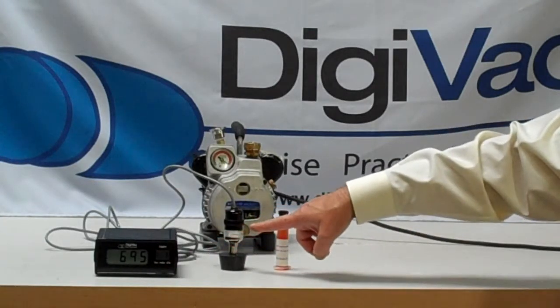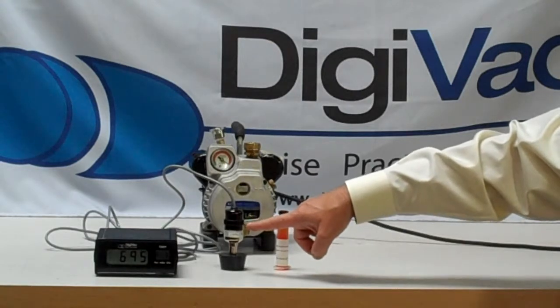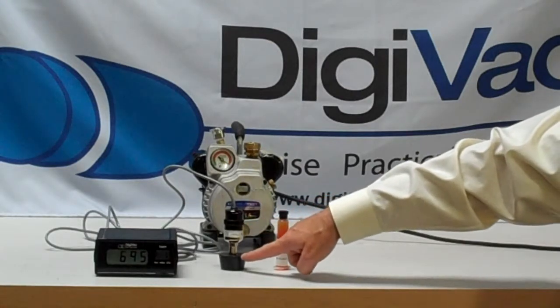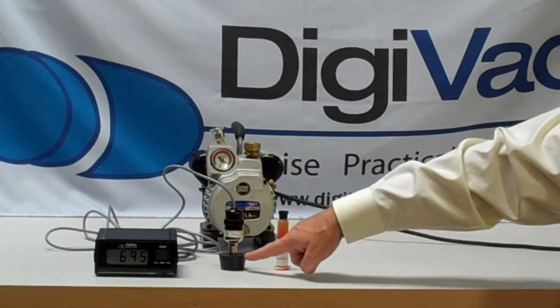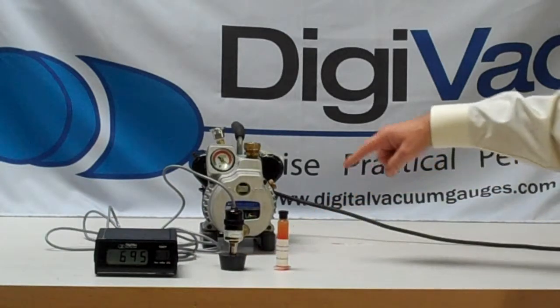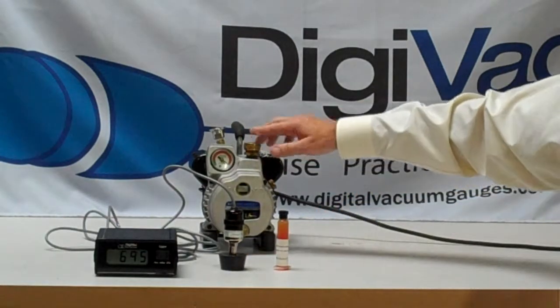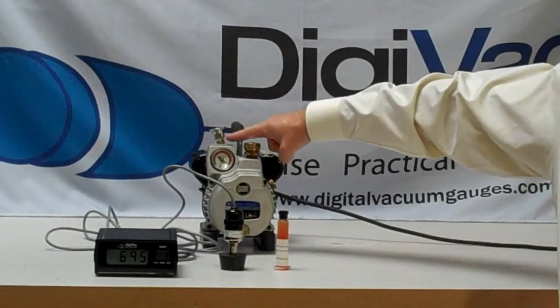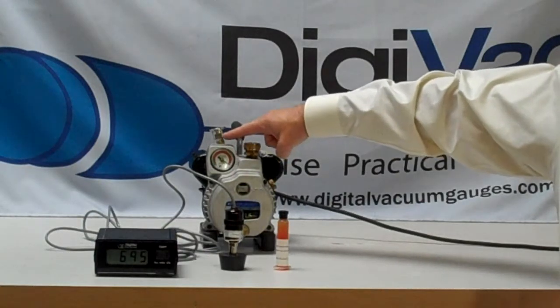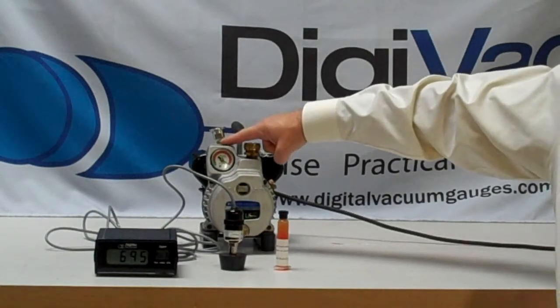The Digivac actually includes a Varian 531 sensor. We adapt a rubber stopper, a very simple McMaster item to get, and on the vacuum pump to be tested we put a KF flange, and we use half of it so we have a nice flat KF flange on which to put the rubber stopper.